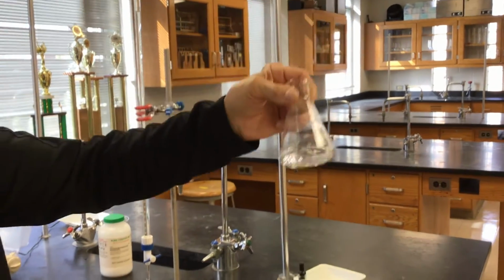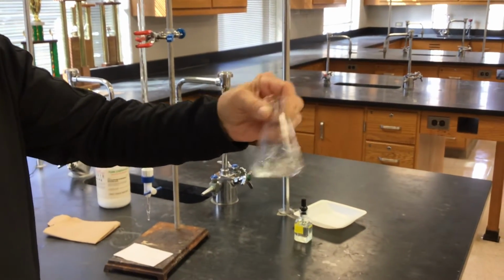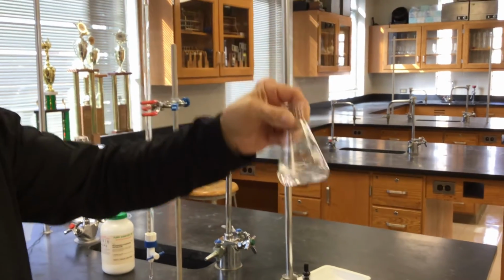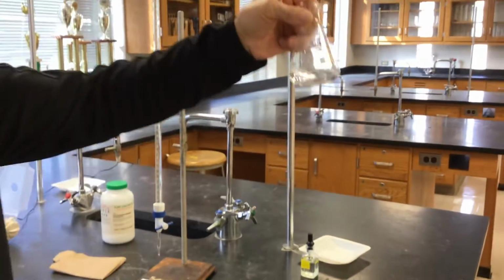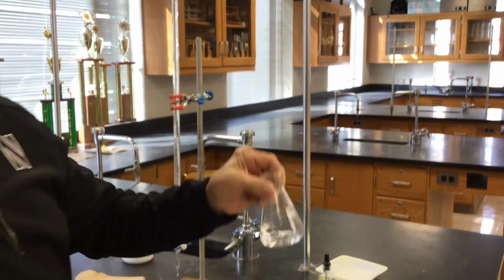Oh, I see. I didn't see that chunk before. Did I say that dissolves fast? Yeah, you did. Thank goodness you can fast forward through some of this.